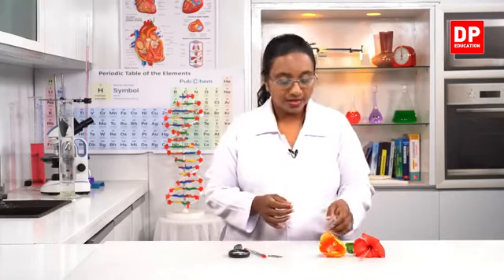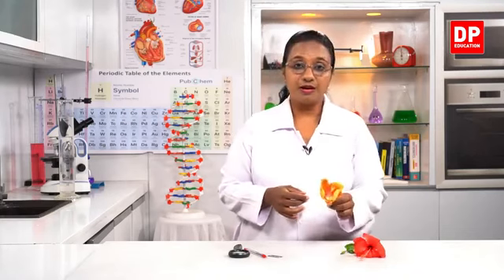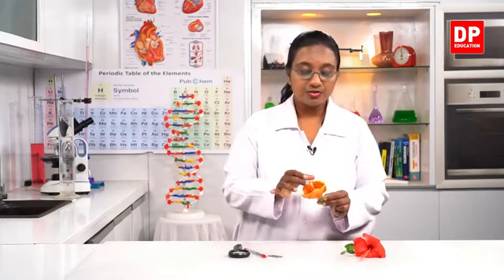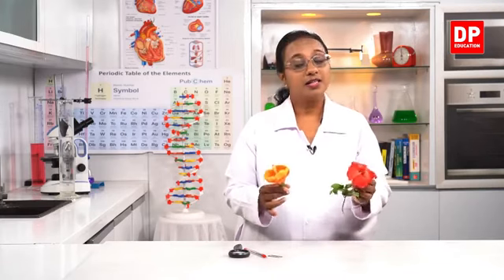Okay, students. Now we are going to observe the parts of a flower. So you're familiar with these parts, and also you're familiar with different types of flowers. You know this is a shoe flower, a hibiscus flower. So this is the bloomed one. And here also you can see another shoe flower. Both are shoe flowers. So you can see the different colors, the differences in all these flowers as well.